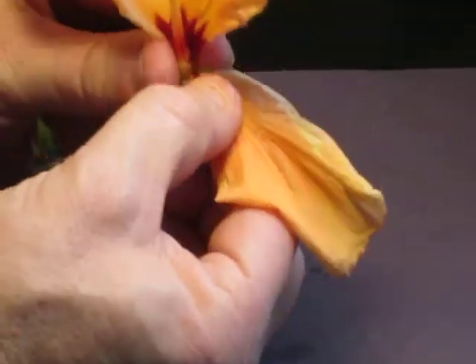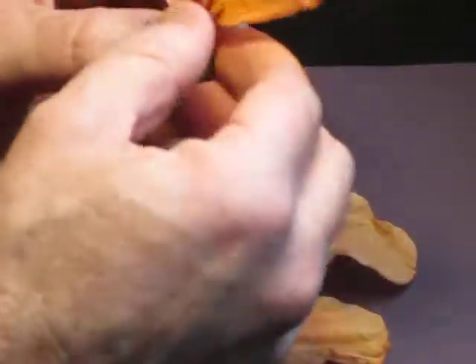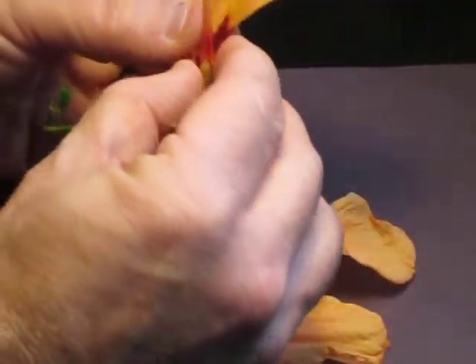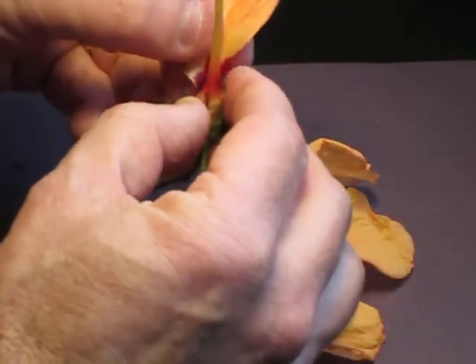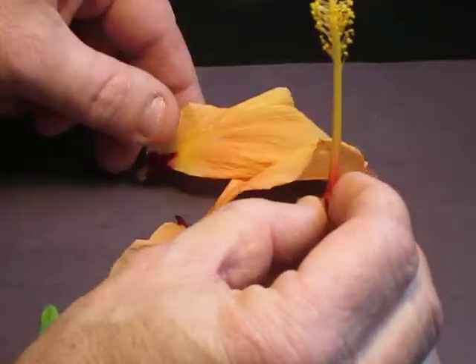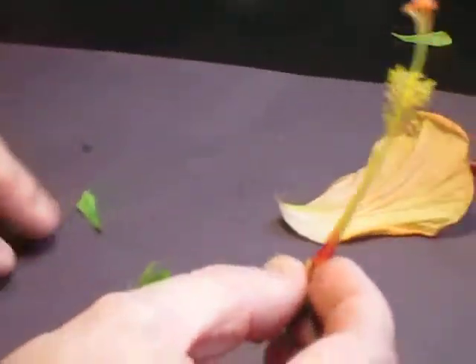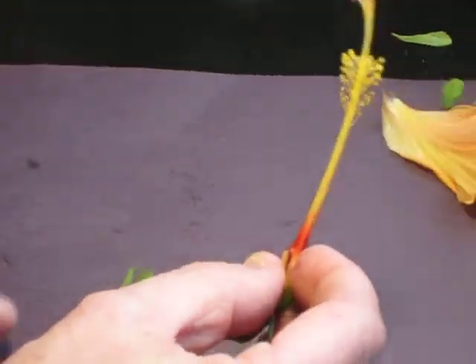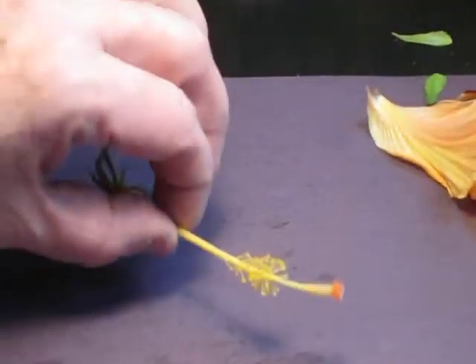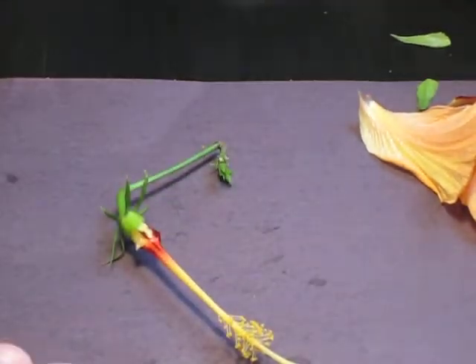And the petals are brightly colored to attract bees, because bees are very important in the pollination process, and there's a little bug right on top of the stigma as we speak right now. But these are the petals, so they attract bees. So I'm going to go ahead and move all this stuff out of the way, and we're going to get to what I think is the most interesting part of the flower, of the dissection process.